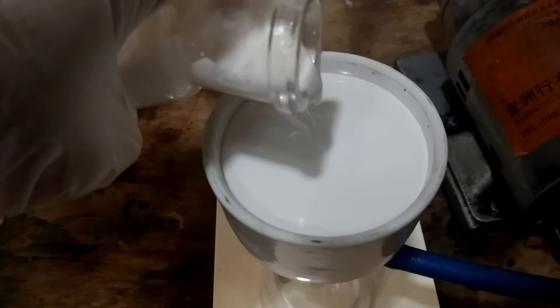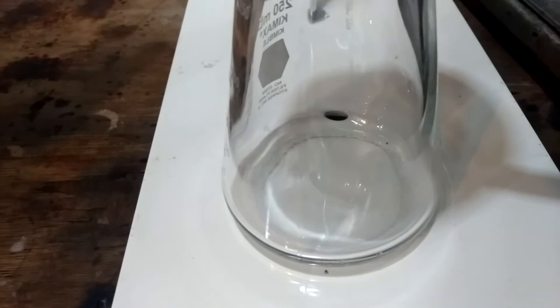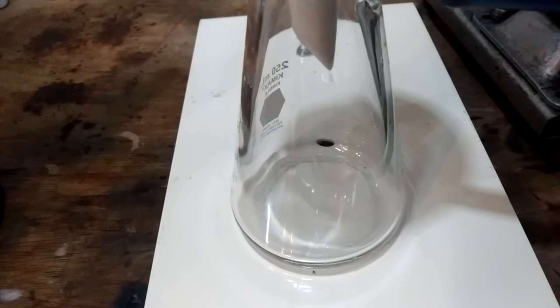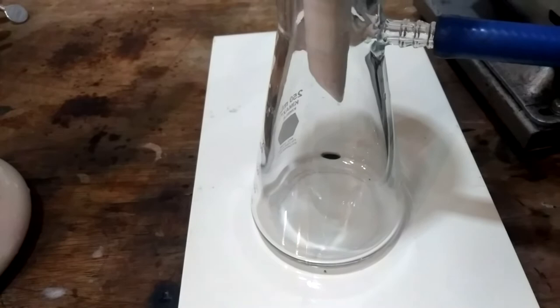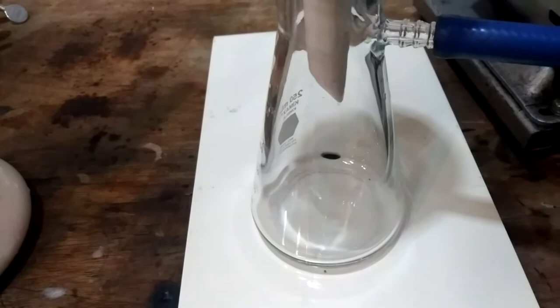If too much sodium hydroxide is left, the slurry will be extremely difficult to filter and no pentahydrate crystals will form. So I ended up adding 5 molar percent of TCCA at a time, taking a little bit of slurry out to check it until significant amounts of crystals formed. Weighing and calculating the total mass of the flask might also be a good method. Measuring the pH is also an option if you have a good pH meter that can work under strongly alkaline conditions.